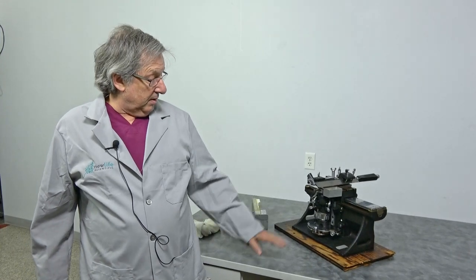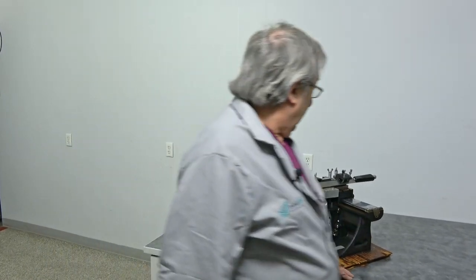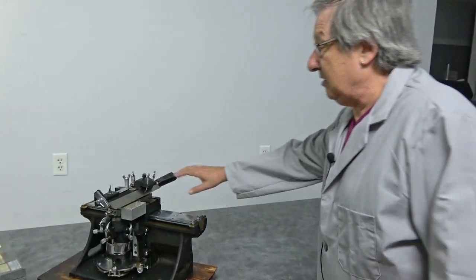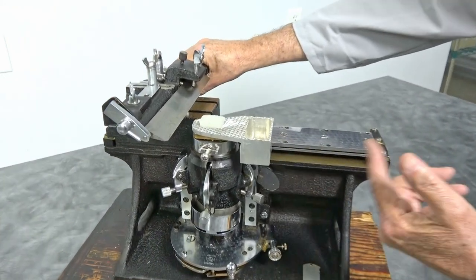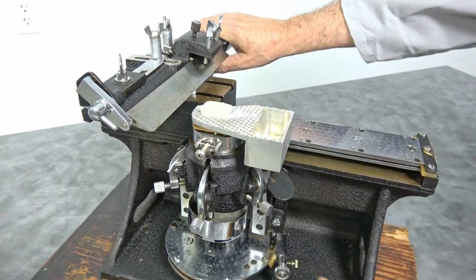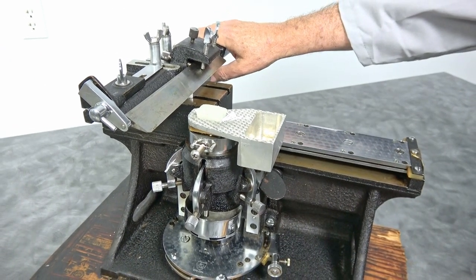It's a Spencer sliding microtome and as the name suggests, it does its cutting by sliding motion. When you go back, the click you just heard is it raising the specimen to the knife.